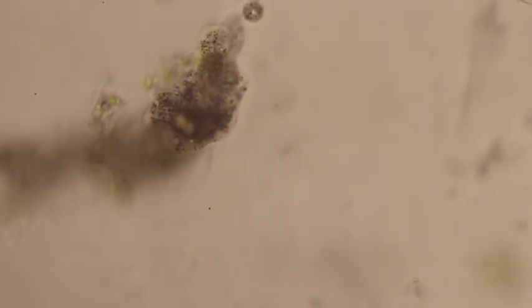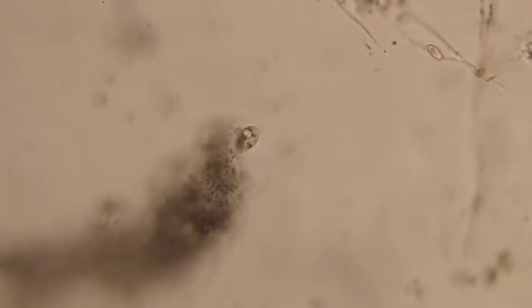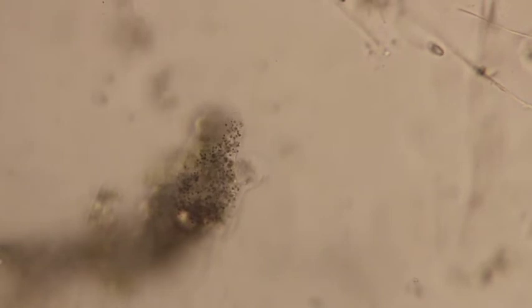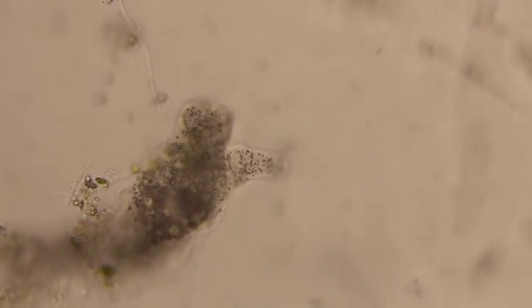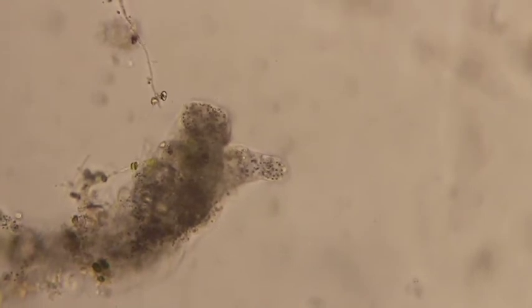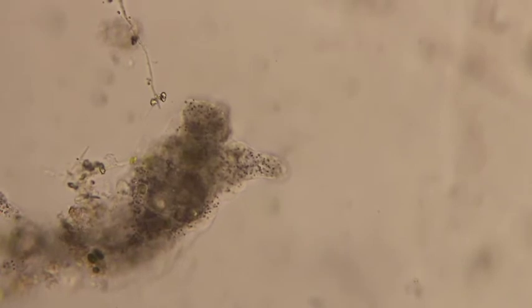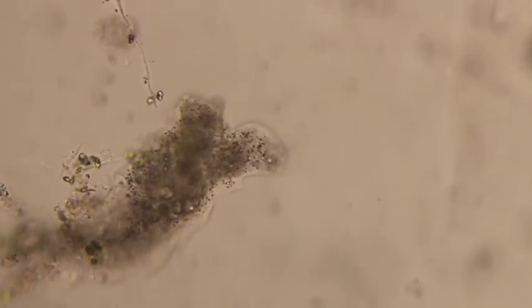Okay, we'll center it on that euglena. We'll see who wins, the euglena or the amoeba. That euglena is staying there. It's not leaving. It's hanging out right where the pseudopodia are. Oop, the euglena left. So this particular amoeba did not get that euglena. Okay, but there's a lot of euglena around. You can see the various euglena that it's already eaten are inside and being digested in the cells.